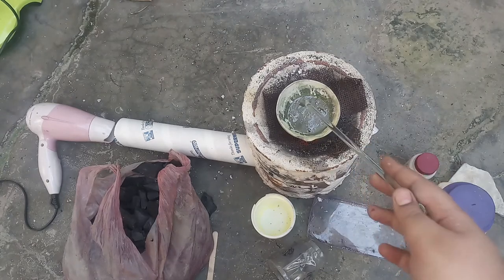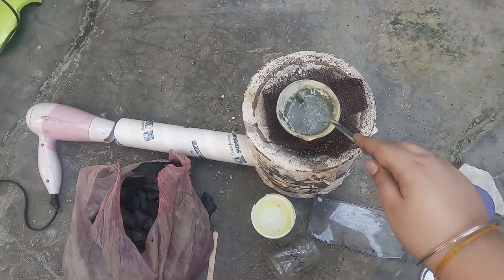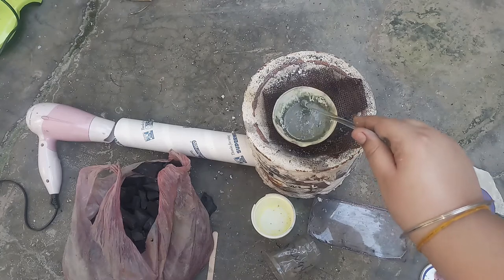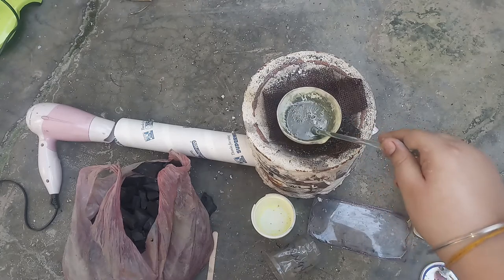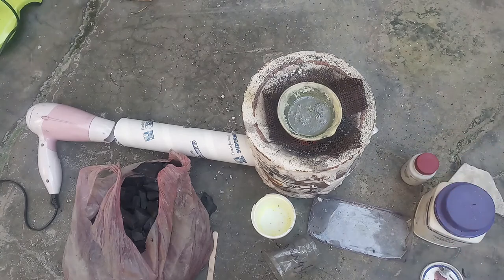Some also use an oxy-propane torch for a faster one-second reaction, but I don't have an oxy-propane torch and it has dangers, so I use a furnace — it's quite safe. Now it has reached 500 degrees Celsius.